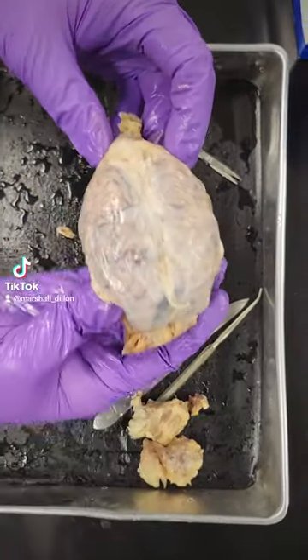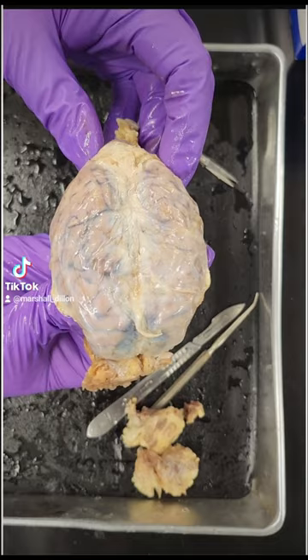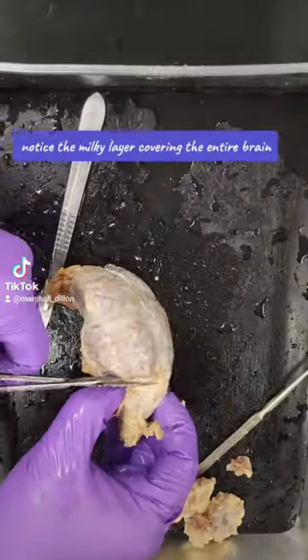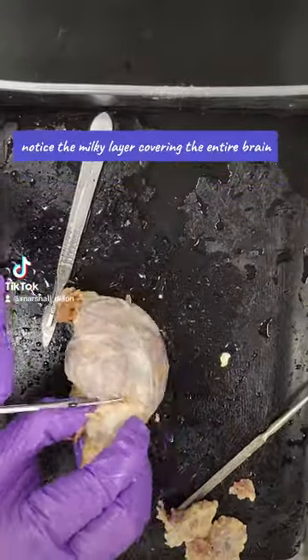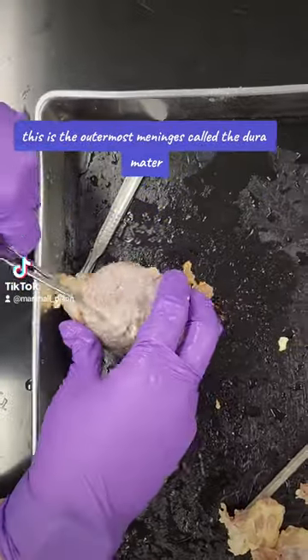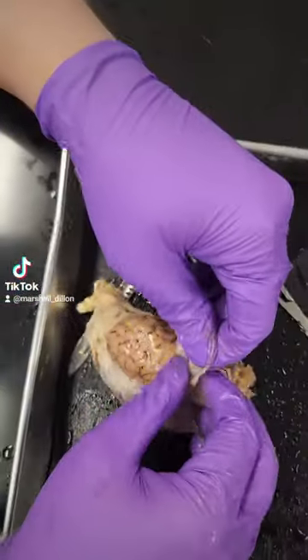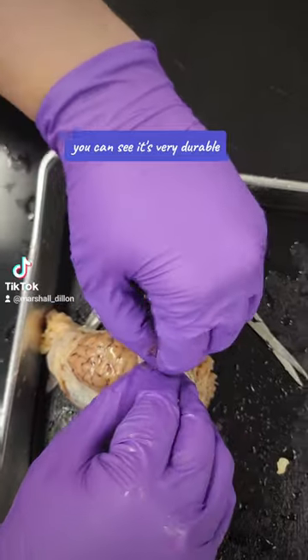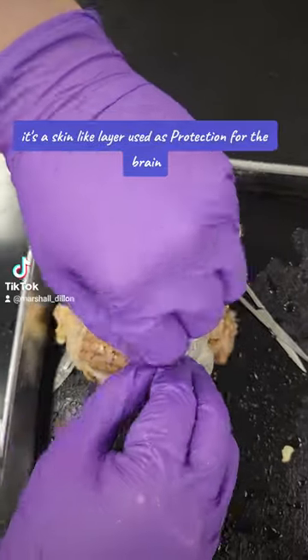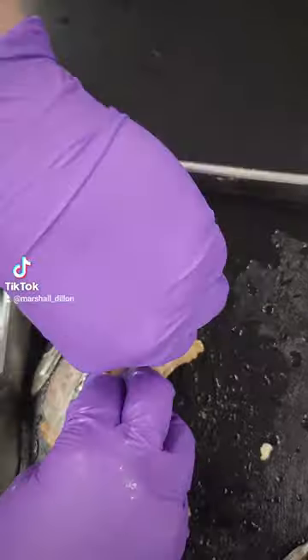Here you can see anterior, posterior, and lateral of the brain. Notice the milky layer covering the entire brain. This is the outermost meninges called the dura mater. You can see it's very durable. It's a skin-like layer used as protection for the brain.